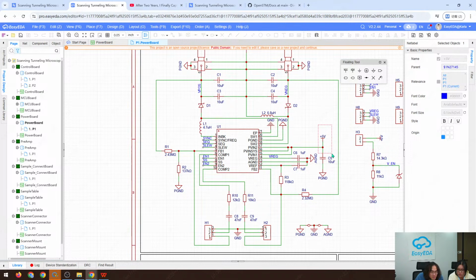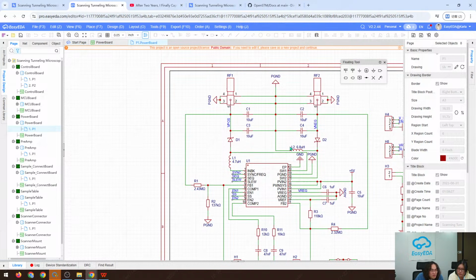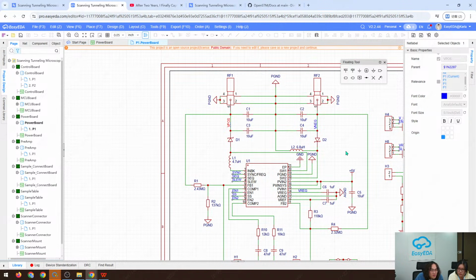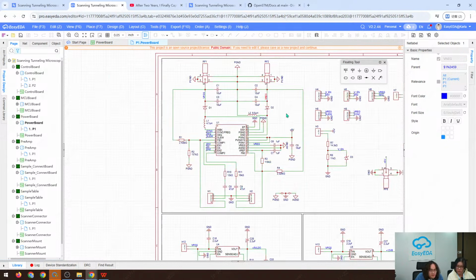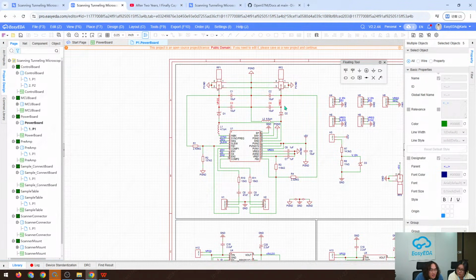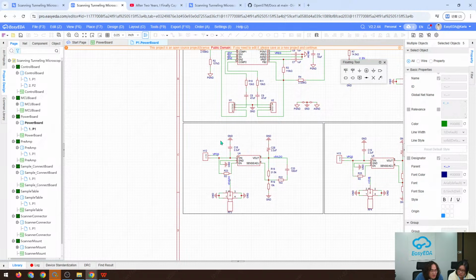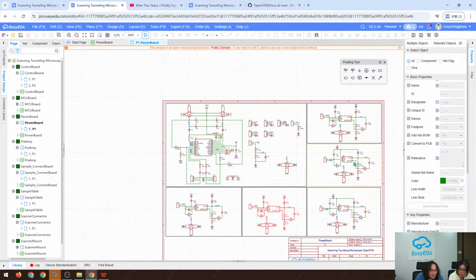Here is the input, and then the booster will boost the 5 volt voltage into, here is the positive, in this case a positive 15 volts, and V negative in this case is a negative 15 volts. Then the positive and negative voltage will feed into the low noise LDOs. Here they are totally 1, 2, 3, 4, 5.